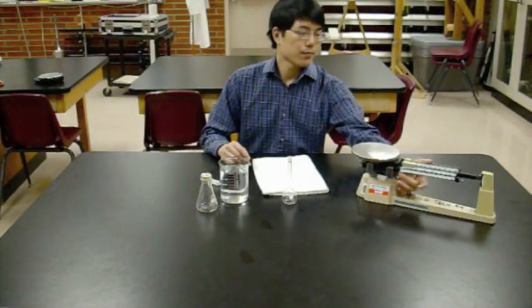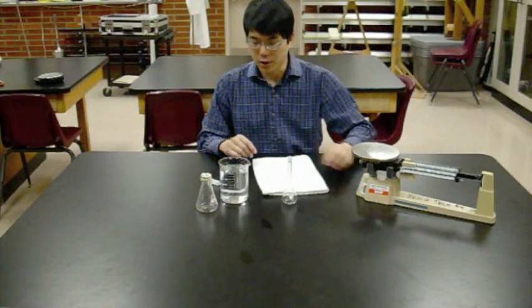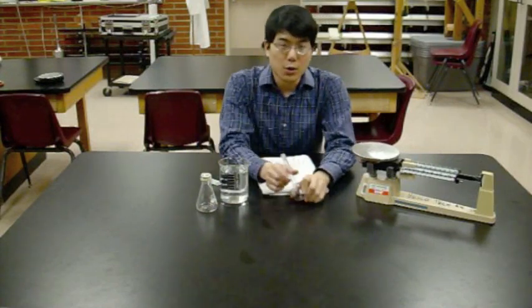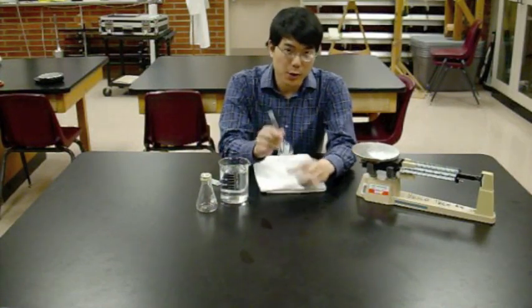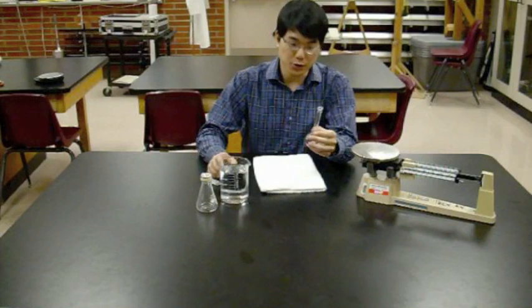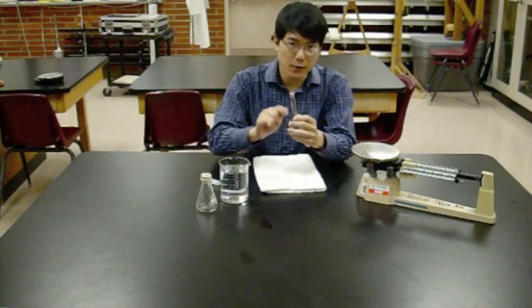When you're done, reset all your sliders. So we got the mass of just the glass part of the volumetric flask. Now we've got to put some water in there. And remember, only fill to the fill line.